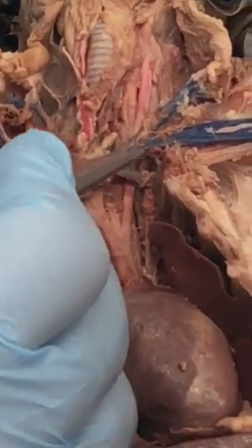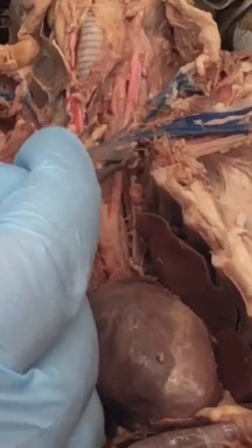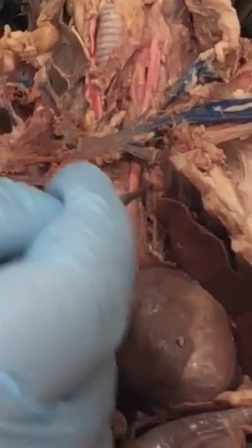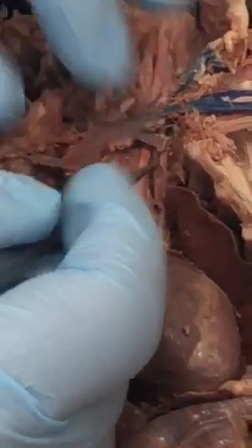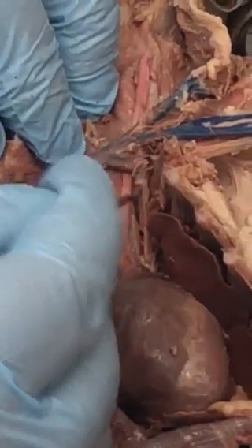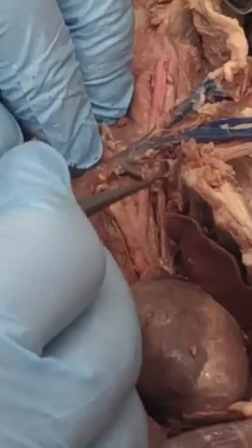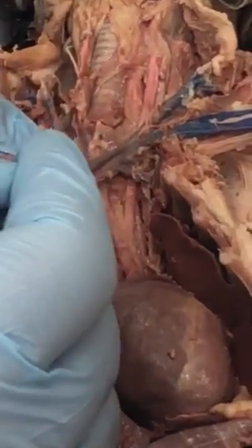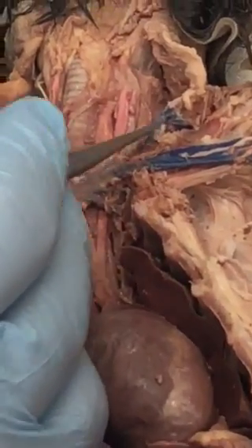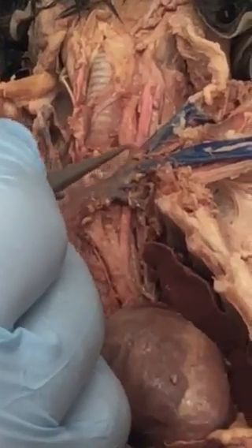We'll just follow it this way. This is called a vertebral right there — it's going to go down and in. It should be off of the subclavian in this area, the vertebral artery, which I'm not really finding all that well. So this is going to branch into subclavian, and then over here is a jugular.